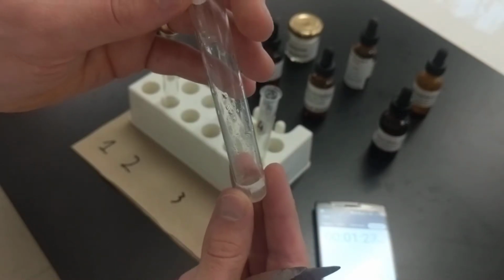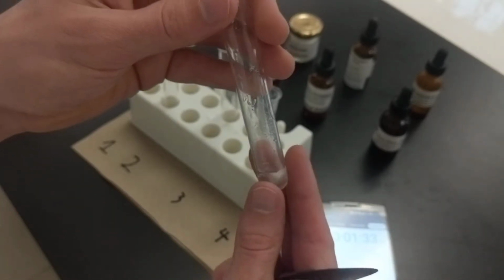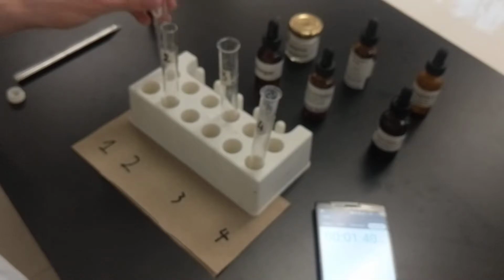We'll see if anything else changes. That's been about 2 minutes because we started a little bit late. This says 1 minute and 30. So I'm going to put it down just so we can continue. But we'll take a look at this at the end of the 4 here, just in case anything does change. We're still hearing the bubbles, but that's okay.